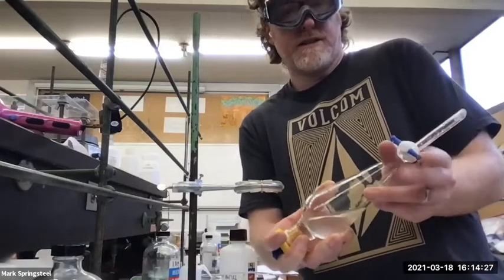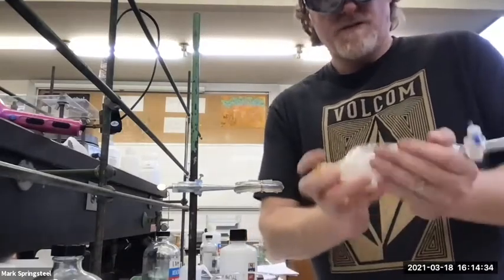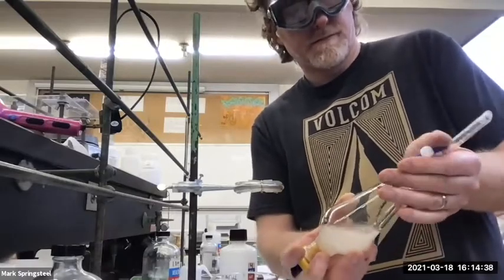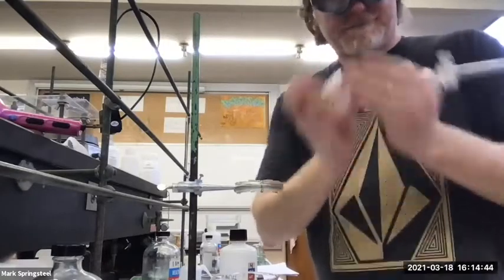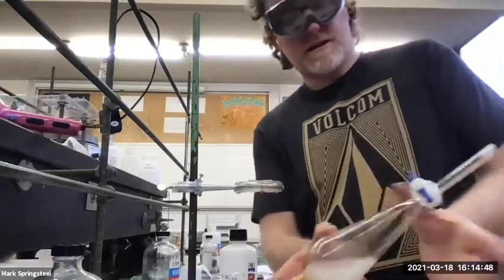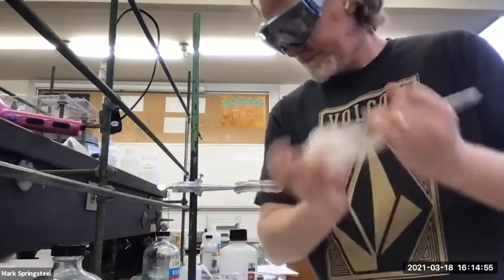Another slow twist and vent. Can you guys hear it venting a little? A little bit, yeah. Good. Okay, now I can give it a little more of a shake. It's got a nice vent to it. Shake, shake, shake. All right, let's get one more shake.